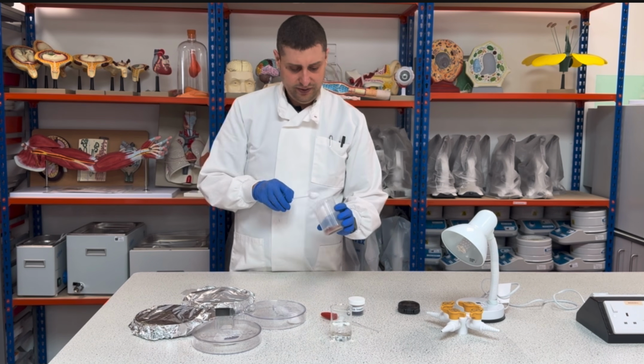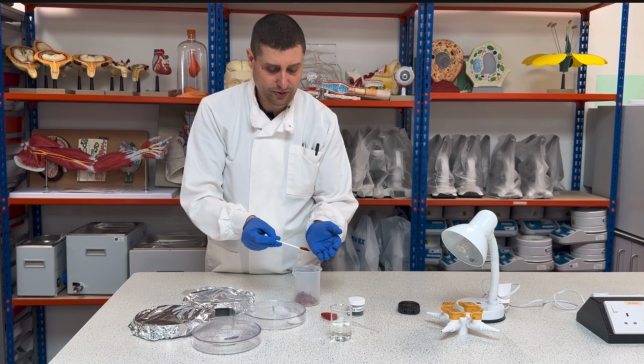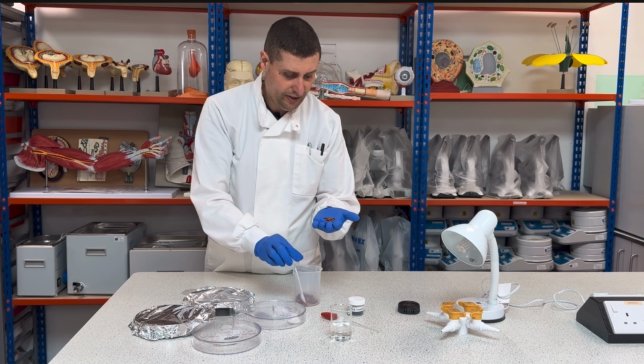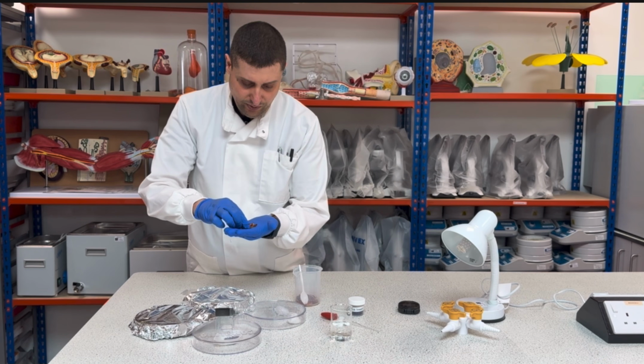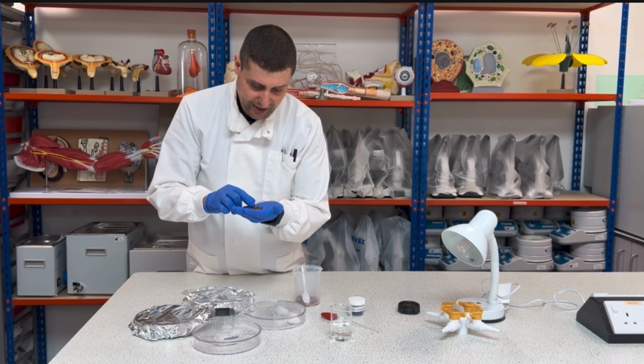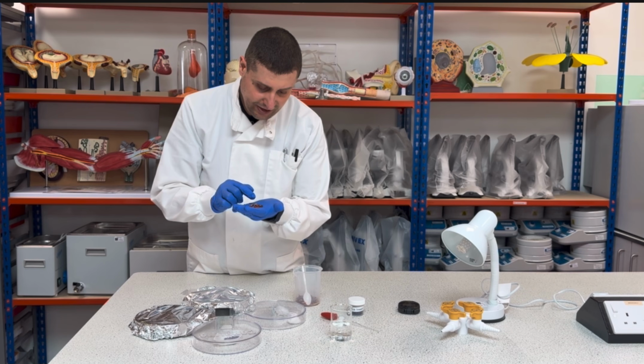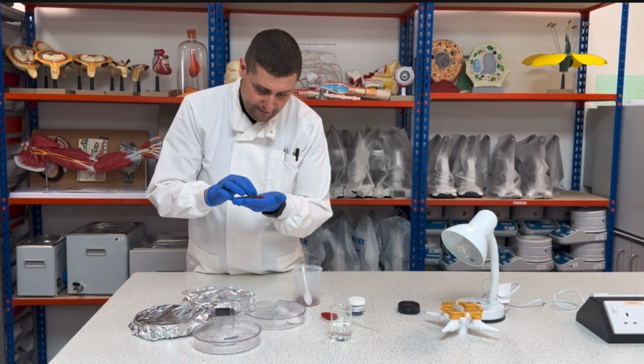As I said, I don't have any problems, so I will pick these here, and I will count: 1, 2, 3, 4, 5, 6, 7, 8, 9, 10, 11, 12, 13, 14, 15, 16, 17, 18, 19, 20.